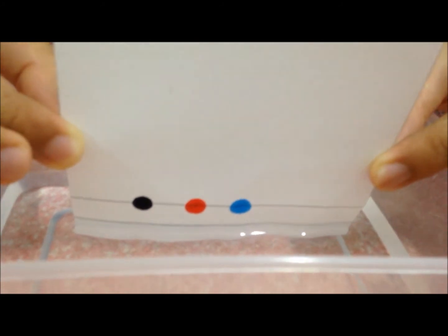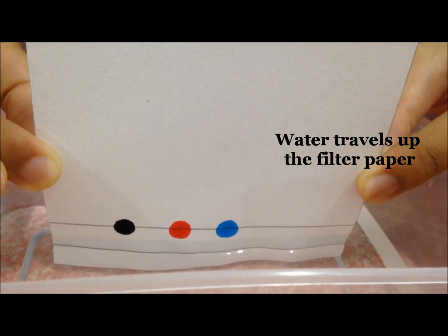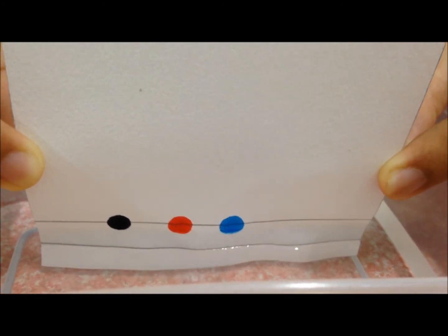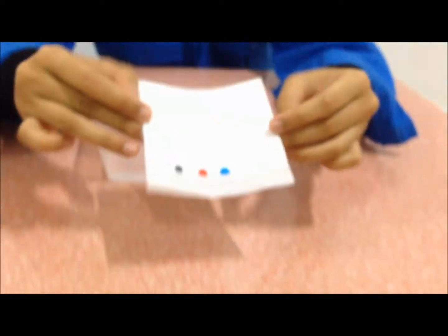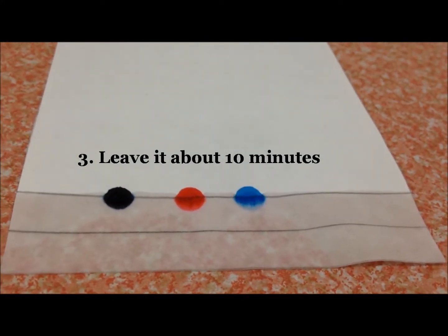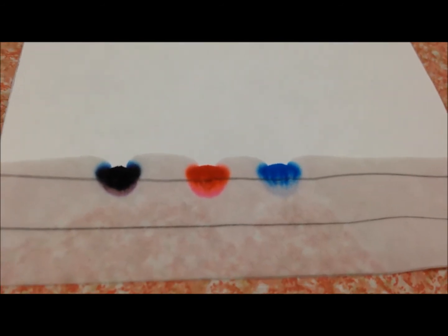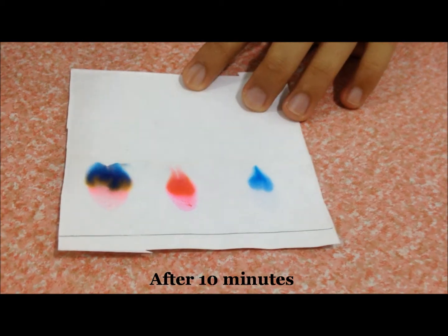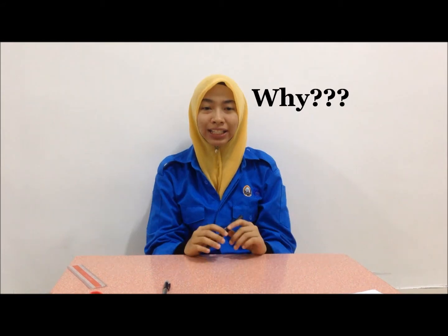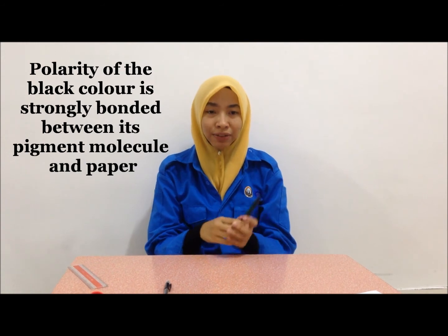We place the filter paper inside the water. We can see the water travels up the filter paper. We leave it for about 10 minutes. After 10 minutes, we can see that the black color spreads the highest among the other colors. This is due to the polarity of black color being strongly bonded between the pigment molecule itself and the paper.